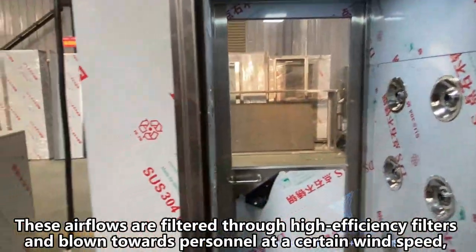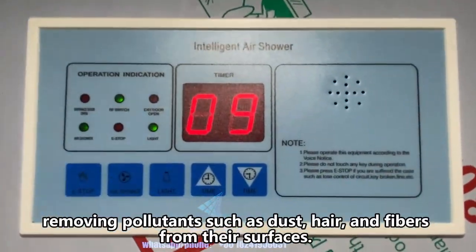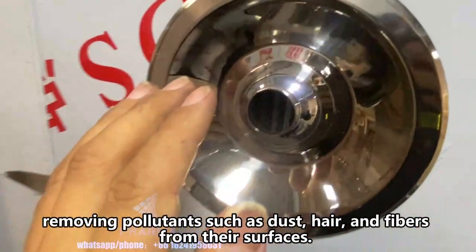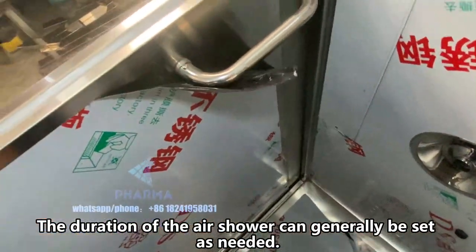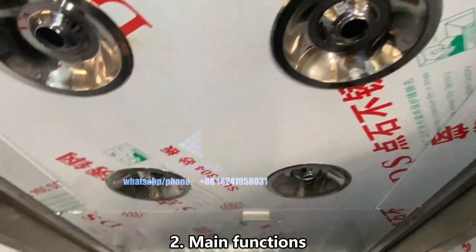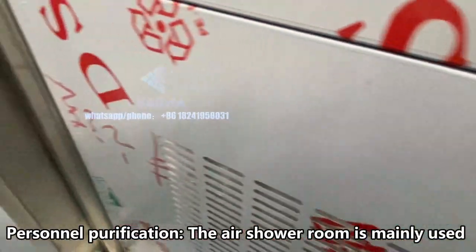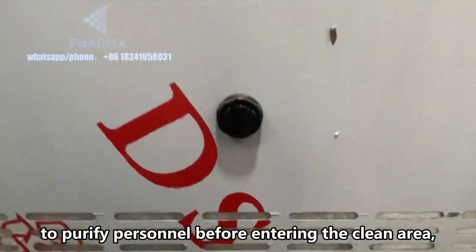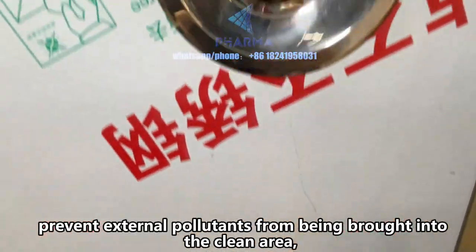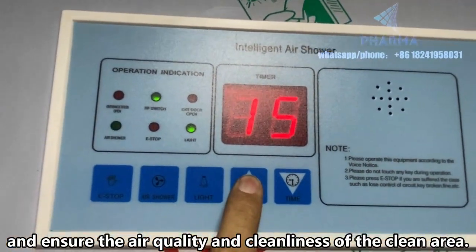The filtered air is blown towards personnel at a certain wind speed, removing pollutants such as dust, hair, and fibers from their surfaces. The duration of the air shower can generally be set as needed. Main function one — personnel purification: the air shower room is mainly used to purify personnel before entering the clean area, removing pollutants from their bodies and preventing external pollutants from being brought into the clean area.